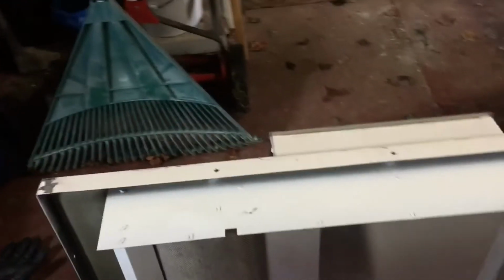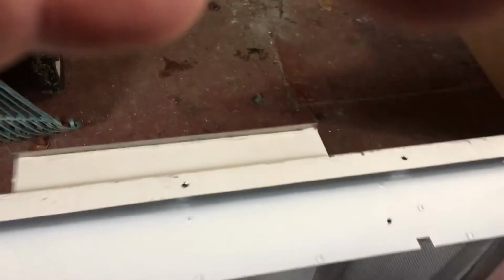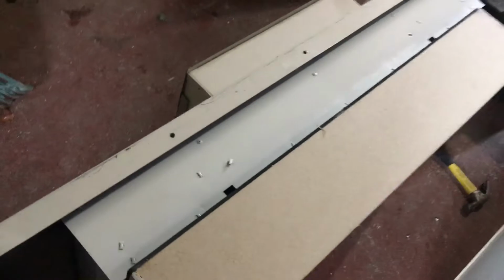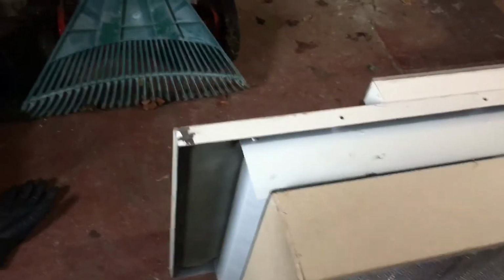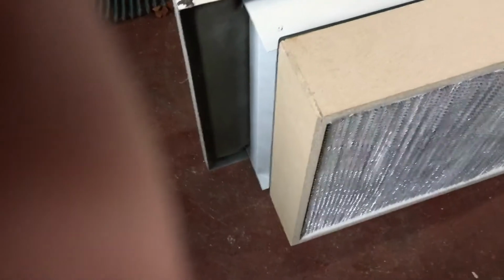Let me get this out of the way. Maybe build some sort of wooden adapter box for that, which might be an idea. It probably wouldn't be too hard, because all I'd have to do is get some plywood to mate across that. Just basically all 4 sides. I don't think it'd be that big of a deal.